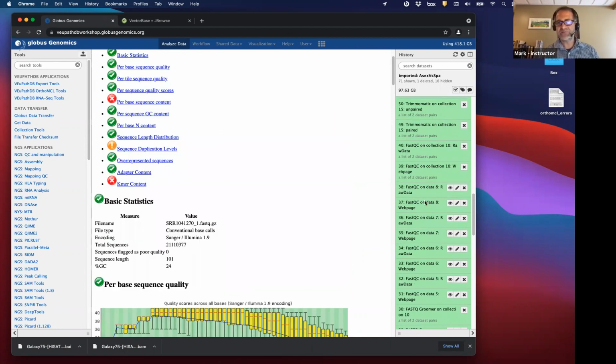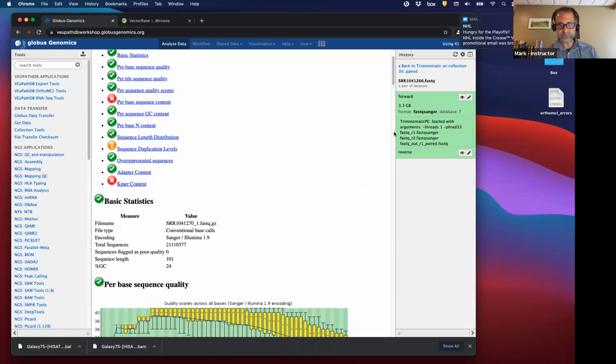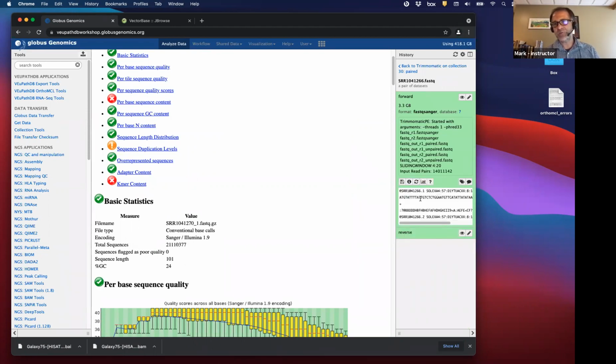And so that's where we use Trimmomatic. Trimmomatic just takes as an input the same data, the FastQ file, and its output is a FastQ file with the trimmed reads. It trims from the ends and it meets a certain specification. So on average, every 4 base pairs have to average a score of 20. So it trims the ends of the reads until that criteria is met.